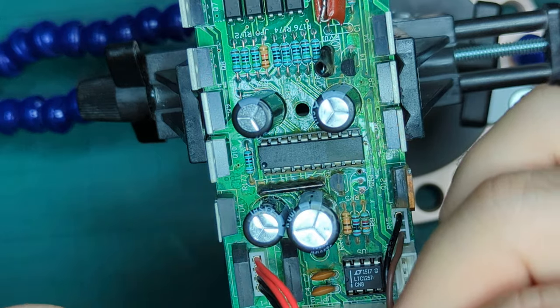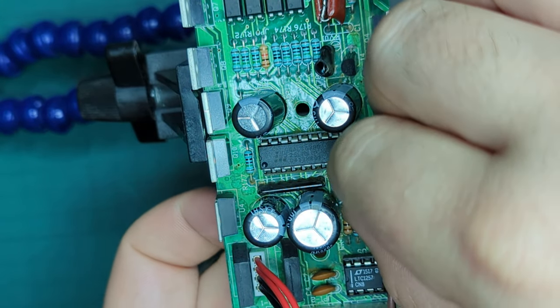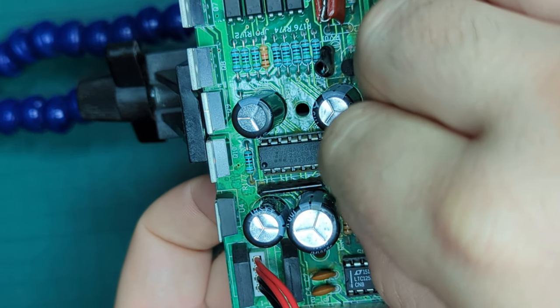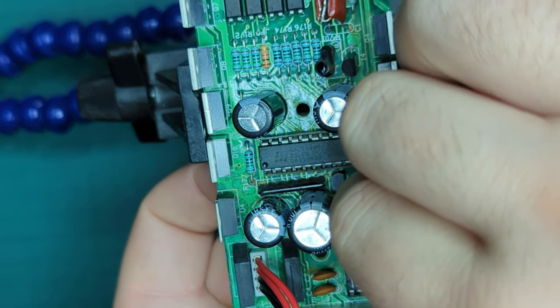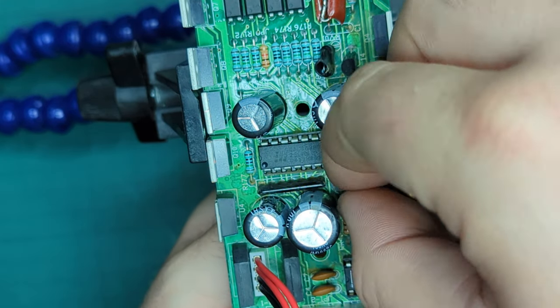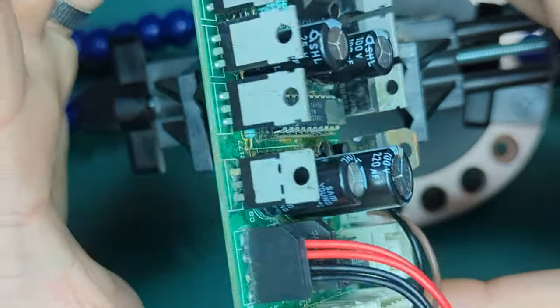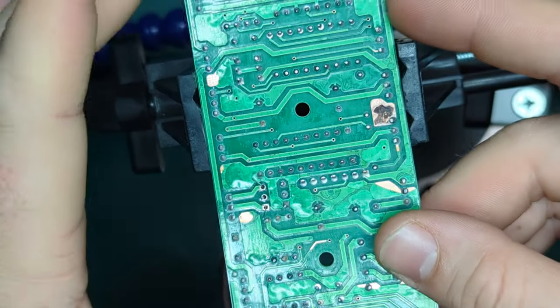You can probably tell it's important to put it around the right way. Each of these legs do different things. There's a base, collector and emitter, I think, but that's kind of beyond the scope of this video. The easy thing is that whoever made this PCB put a little silkscreen mask over the top, just in case you've forgotten. Once I bent the legs in place just to hold the part, I could flip the board over and solder it from the back.